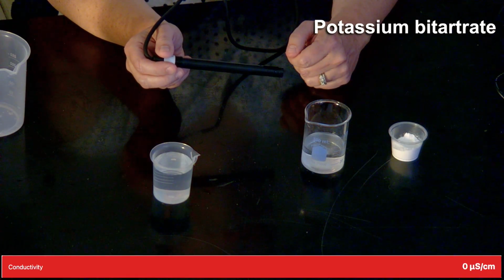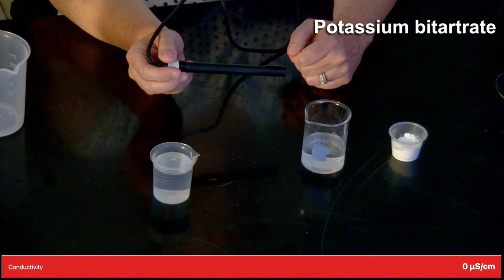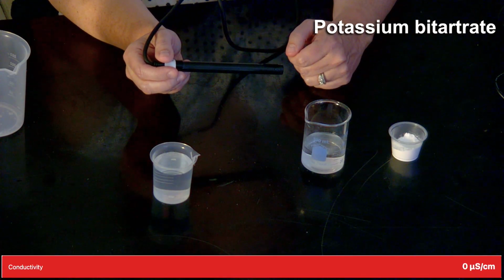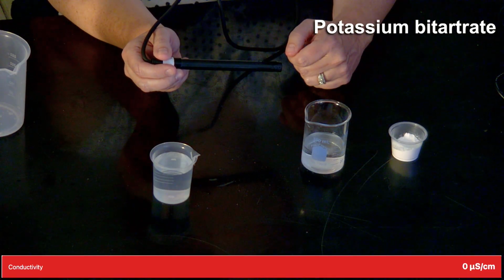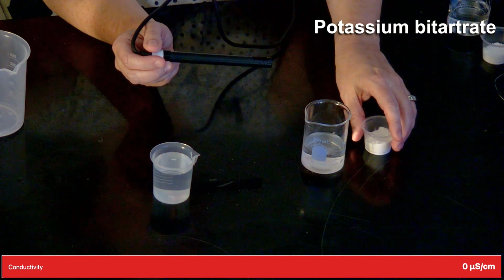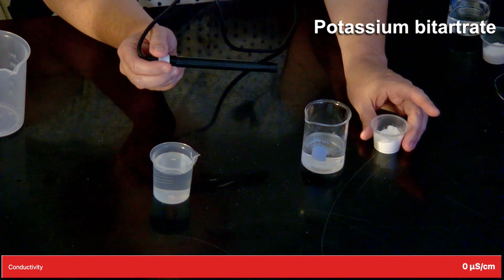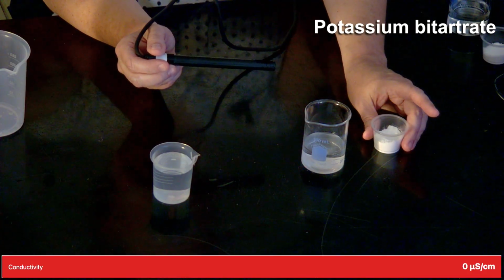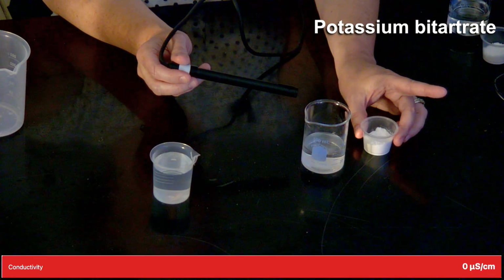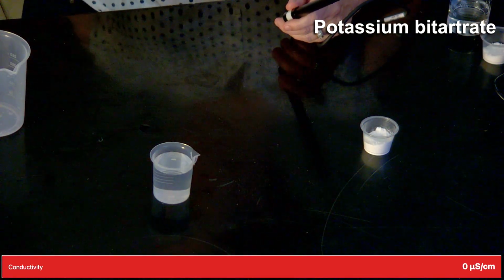So that first one was conductive. Yes. Do you want to start from the top? Yeah, just go before you start introducing. We can switch the camera, because you were talking about how granular it was, but we hadn't turned the light up yet, so you couldn't tell. That's why I paused. But then I redid it. Do you want me to start with the first substance again, or just start with this second substance again? Let's do the first one, so it's in frame and focus the whole time. Oh, okay, gotcha.